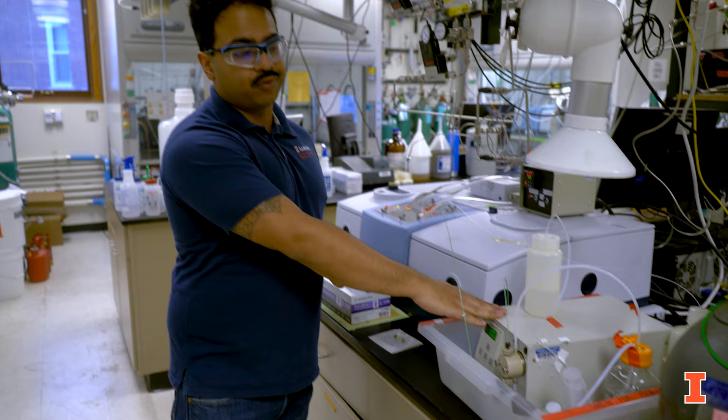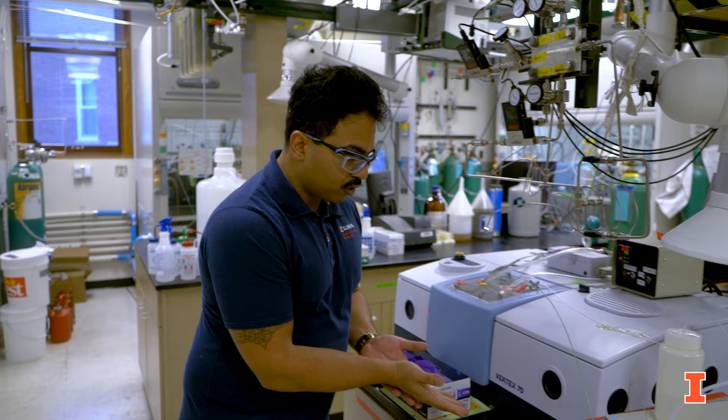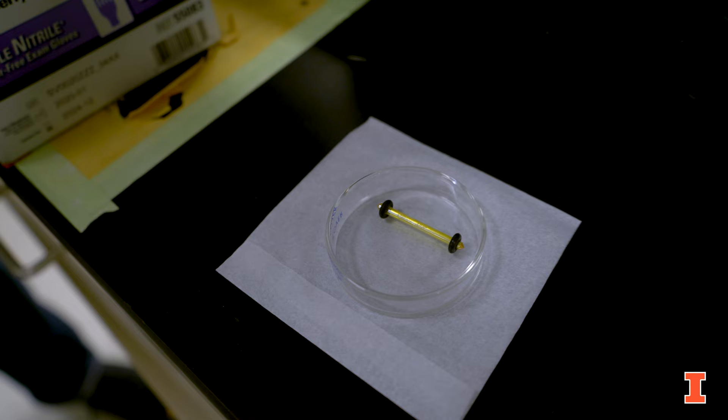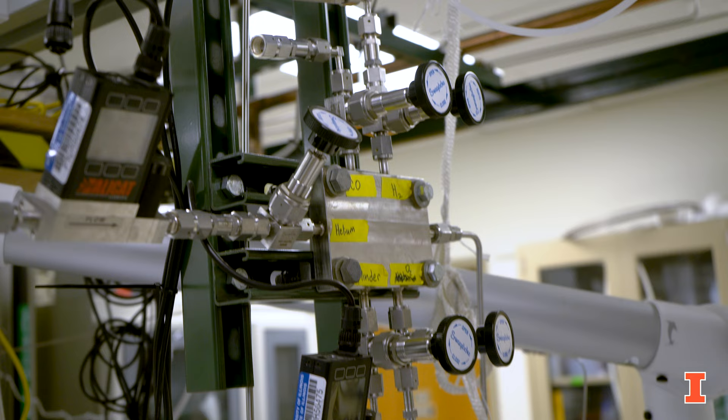Right here I'm actually flowing solvent using a high-performance liquid chromatography pump through an IR liquid flow cell, where the solvent is flowing over catalysts over an internal reflection element. This allows us to further explore and spectroscopically observe changes in the solvent structure as we change reaction conditions of the system.